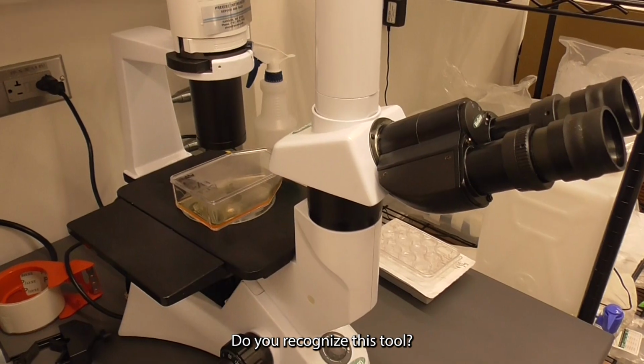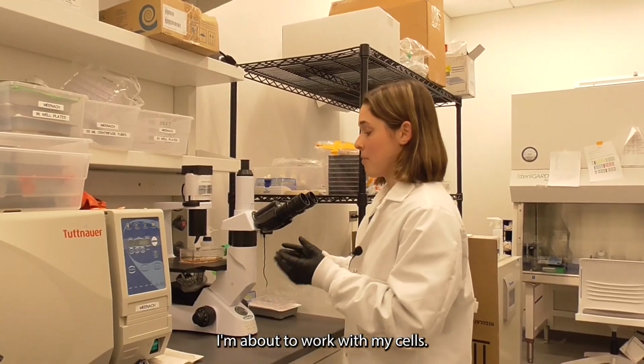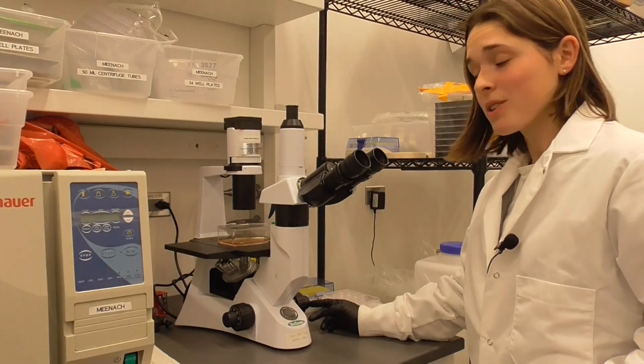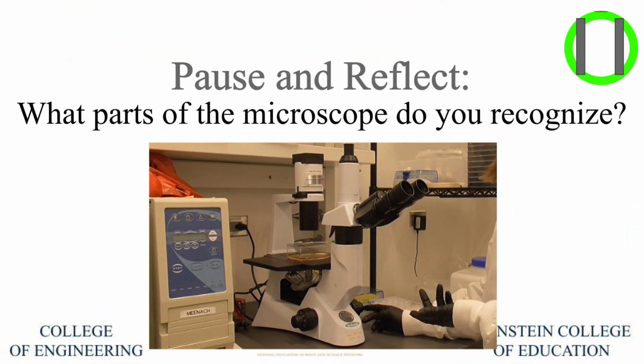Do you recognize this tool? This is our microscope, and I use it anytime I'm about to work with my cells. It allows me to see the cells really close up before I work with them. What parts of the microscope do you recognize? And what are these parts used for?